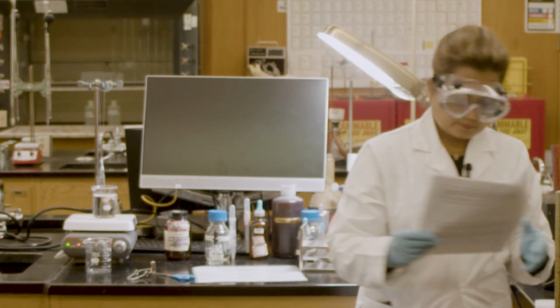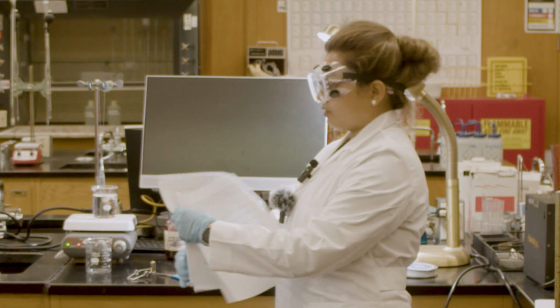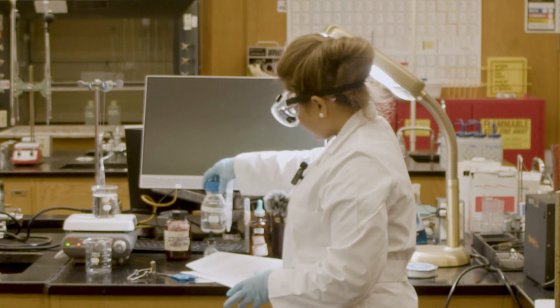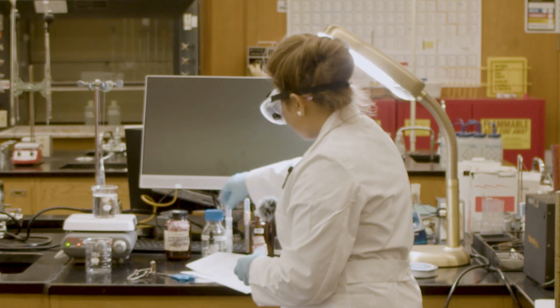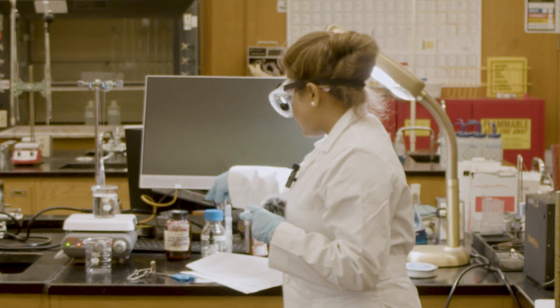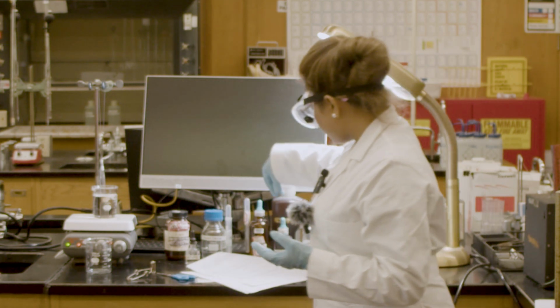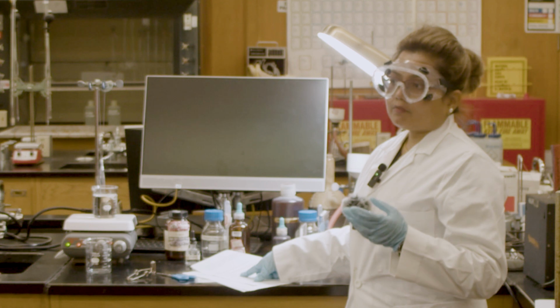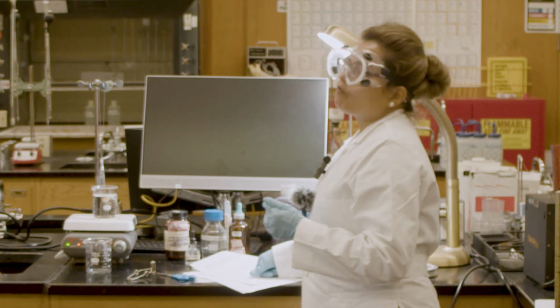For part 1, we will demonstrate and show you different types of solution. Here we will use barium chloride solution, and we will also use starch. Barium chloride contains two types of ion, barium ion and chloride ion. We will use sulfuric acid to investigate the barium ion, and silver nitrate to investigate the chloride ion. Both will show a white suspension, a white precipitate.